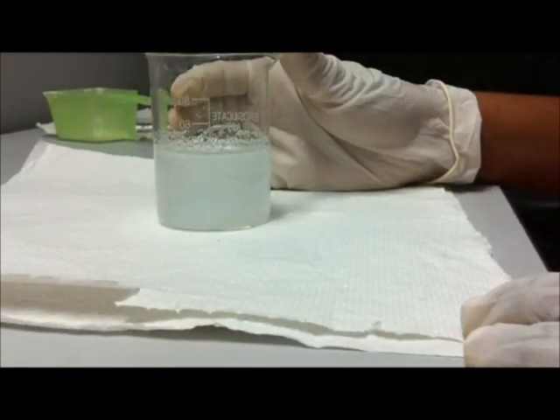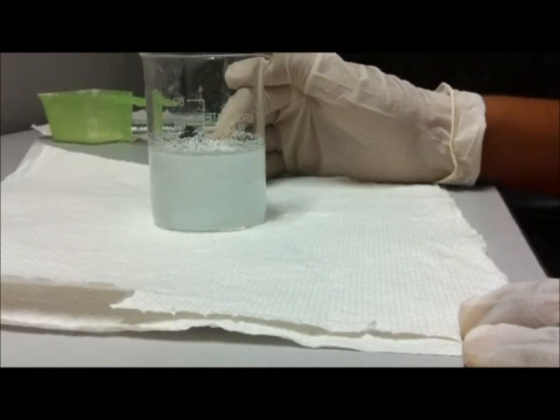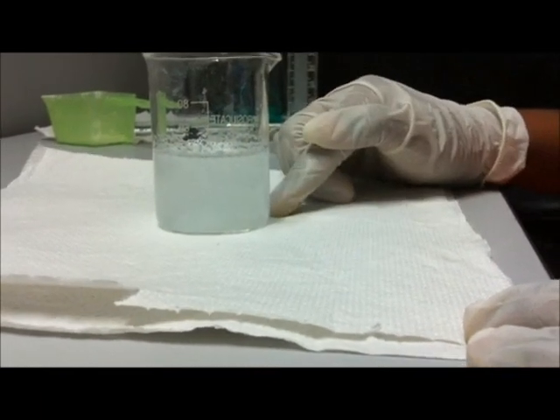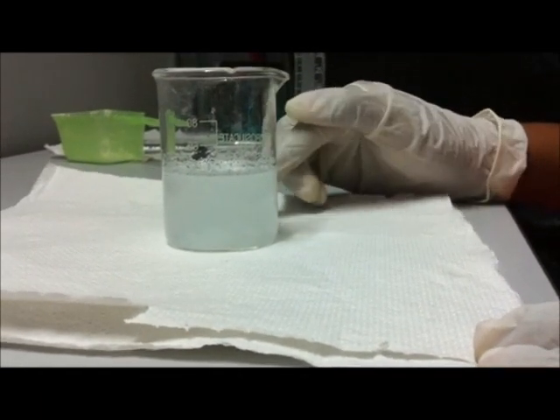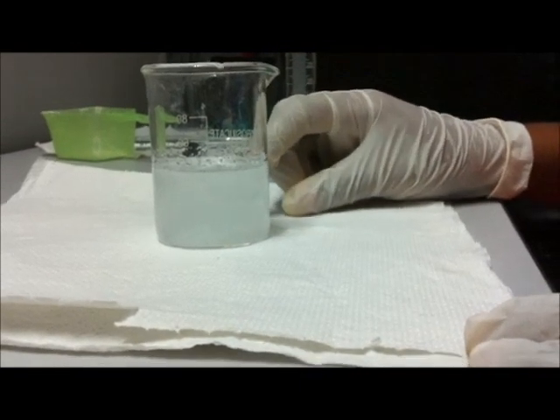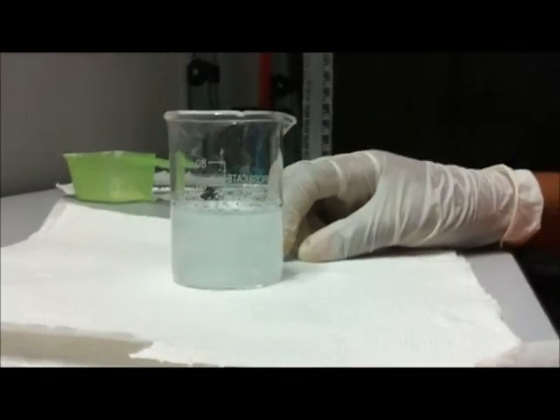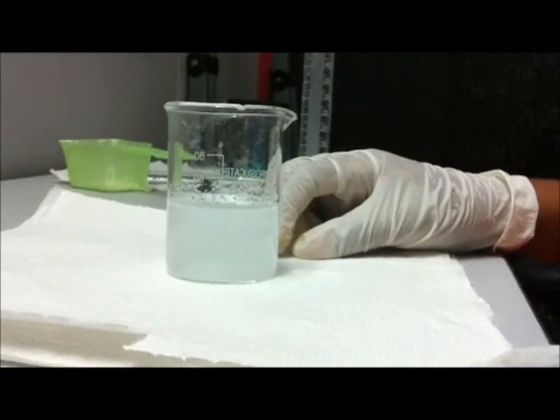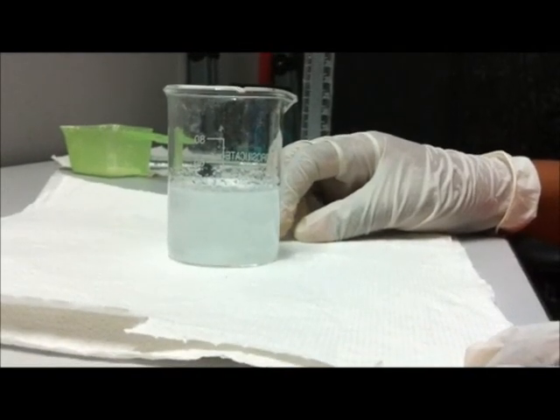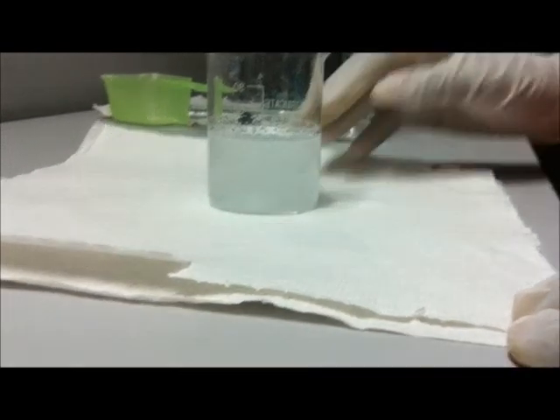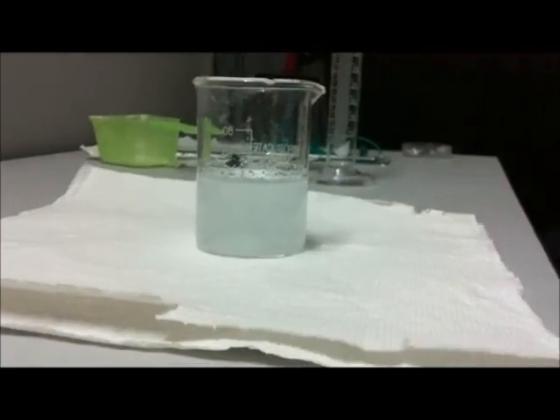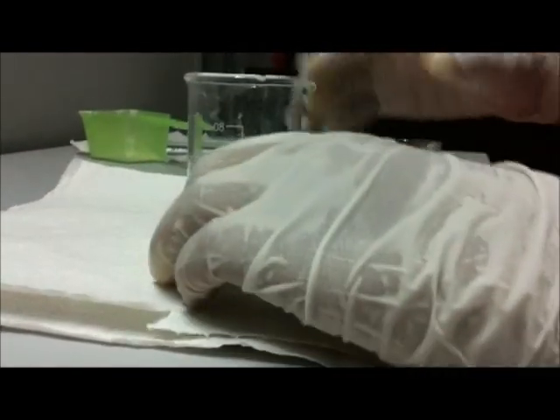If you look at the beaker you can see a large amount of the powder is not dissolved. It's because of impurities in the powder that I have been using. Be sure to filter out any excess that doesn't dissolve and then start the electrolysis. Otherwise, impurities in your beaker before electrolysis will contaminate your final product.